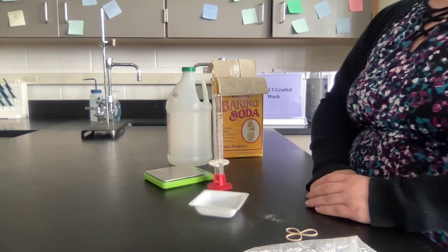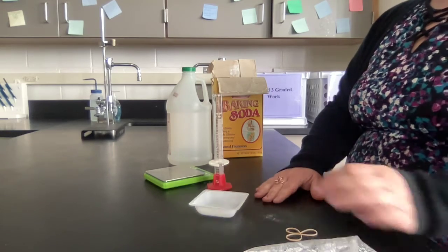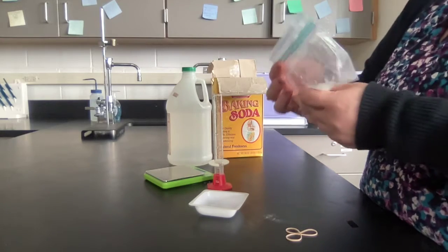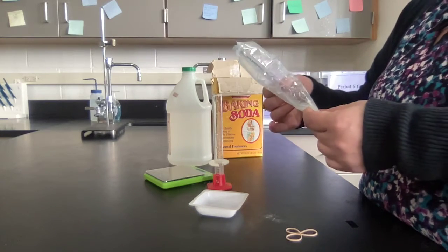And then you can make adjustments based on what you see. So you might be able to see in here what the limiting reagent is. Maybe you need to add more of that limiting reagent.